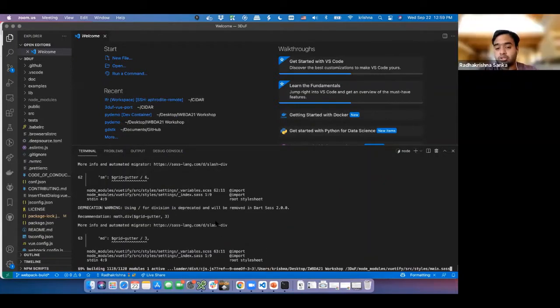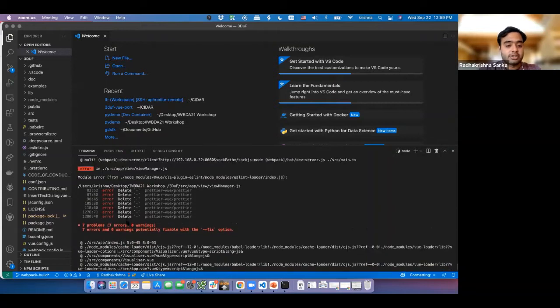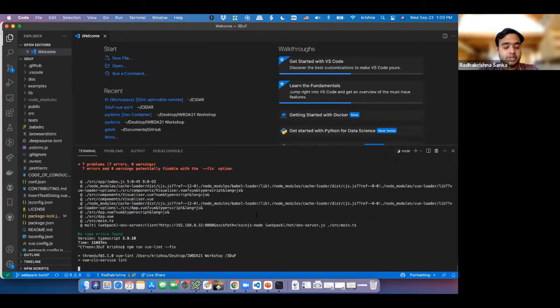Yeah, and it's actually super simple. In fact, we have a process so that in case you make a contribution and you want to make sure that whatever you have is going into the pipeline, we have a mechanism for vetting everything. And of course, I have all kinds of crazy things going on in the background. But we have mechanisms for making sure that all the things are coming in, and it's super easy. You don't need to have anything loaded online. It's giving me some errors over here, which we can fix without any hassle by just running a lint function. By just running that, I quickly fix all the linting errors.